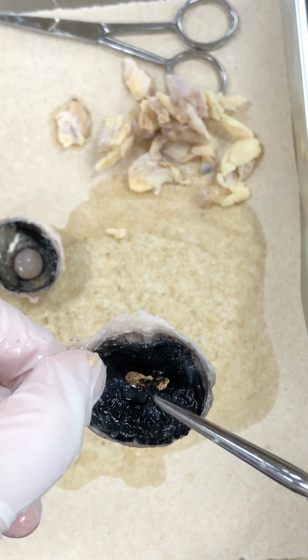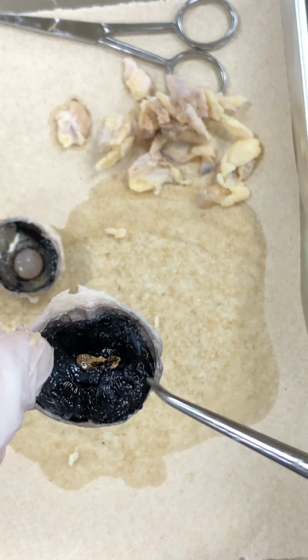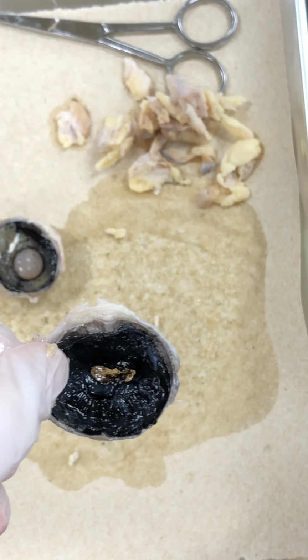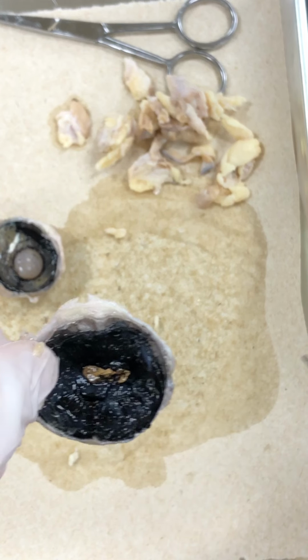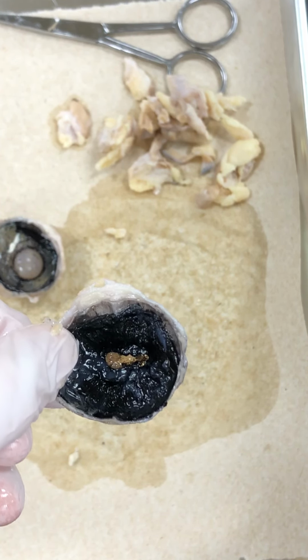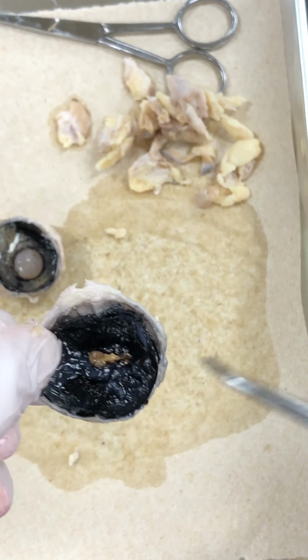There's some fluid in there too. But that aqueous humor, that's going to lie between the cornea and the lens. Okay, it's a fluid. That's all the fluid that is now on my paper towel. And that's going to help keep the shape of the eye for the sheep and for us a circle. Okay.